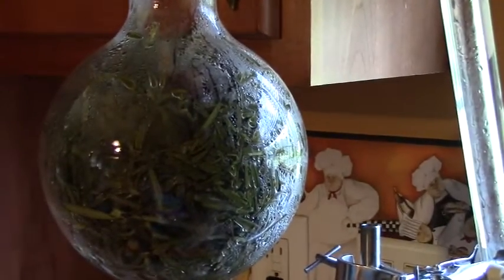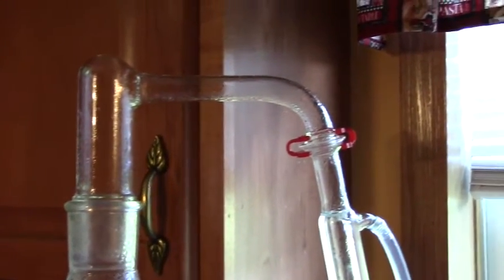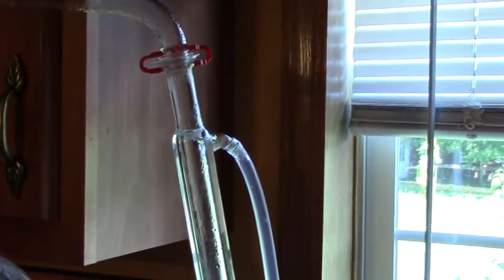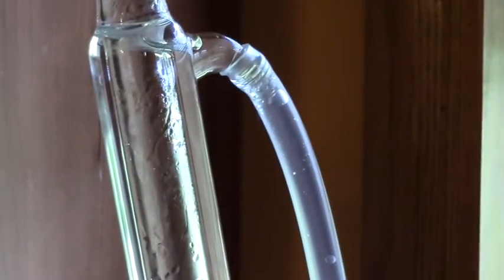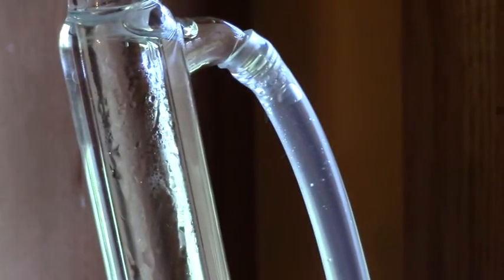Get a little close up of it. There's rosemary inside, through the flask system, over, across, and down to this part that has a double wall on the tube on the left.